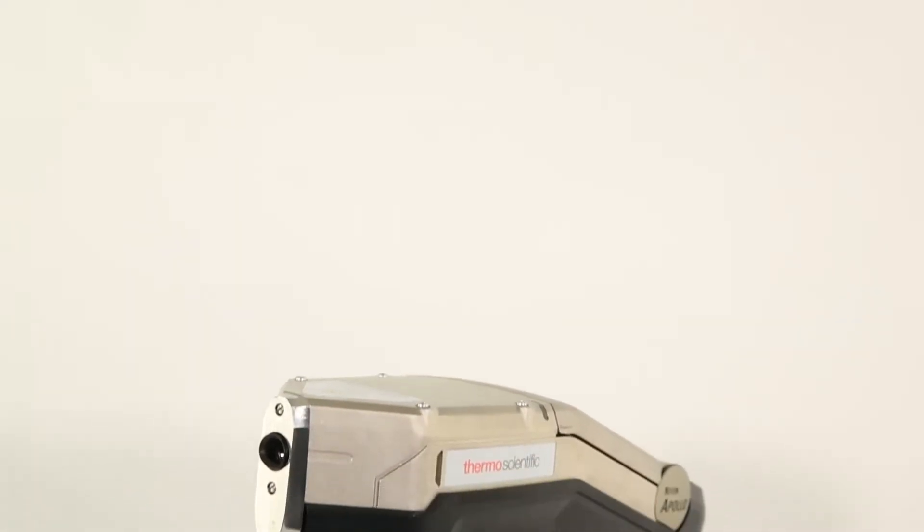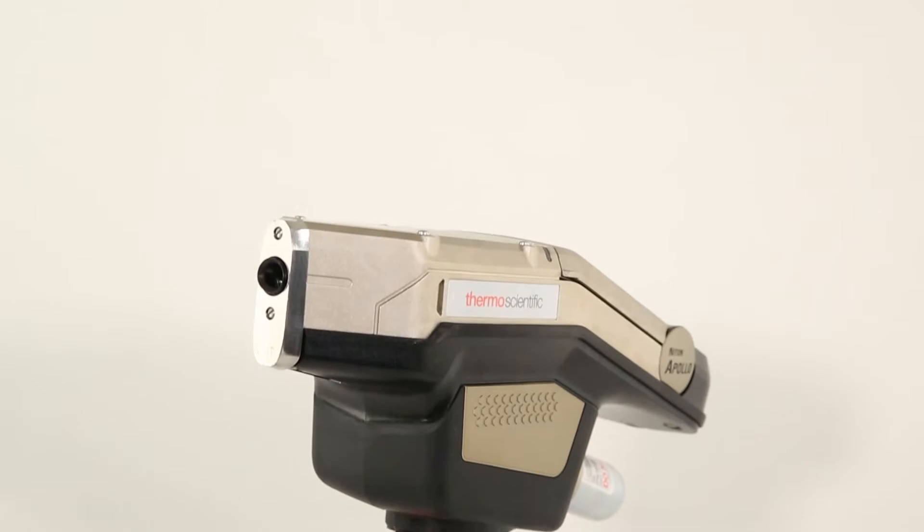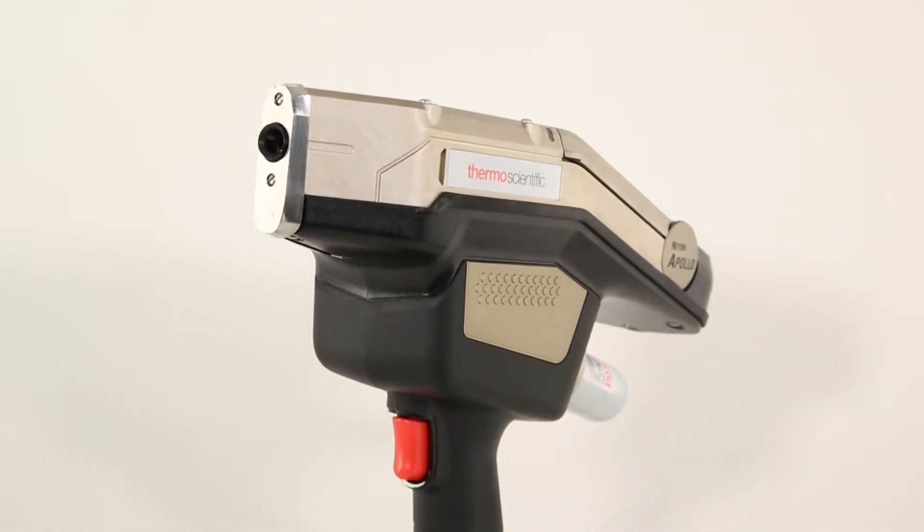This video will provide you with instructions on how to clean the sample chamber of the Niton Apollo Handheld LIBS Analyzer.